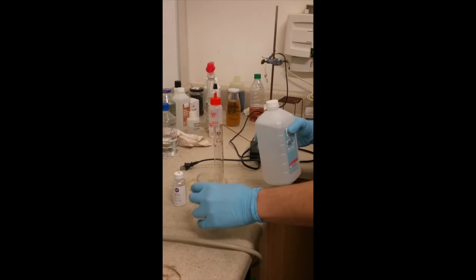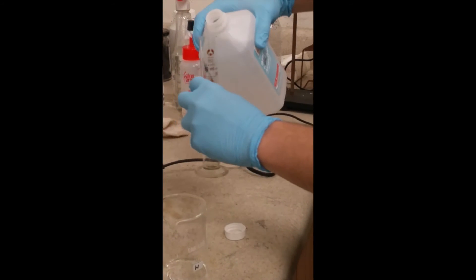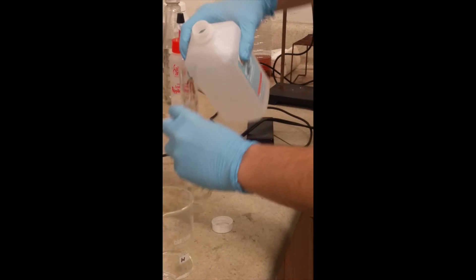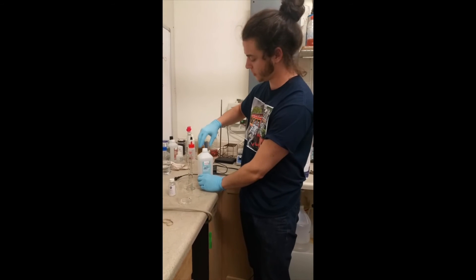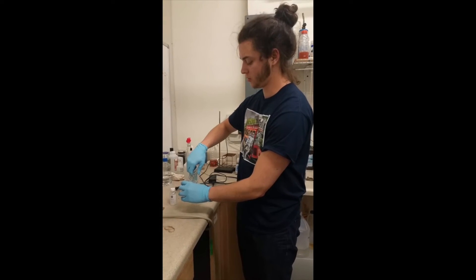I'm going to dissolve it in isopropyl alcohol. Since there's some thickening agents in the glycerin, I'm going to just kind of douse it in alcohol. So since I have roughly two grams of that glycerin, I'm going to use like 30 milliliters of this 91% isopropyl alcohol and use that to mix, just to make a nice steady solution.